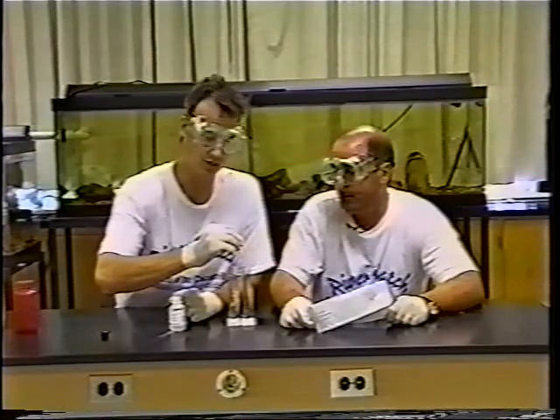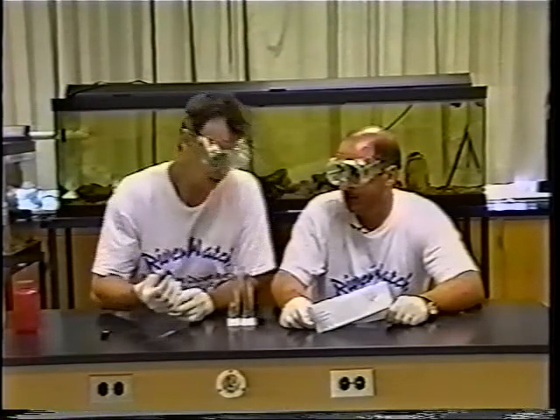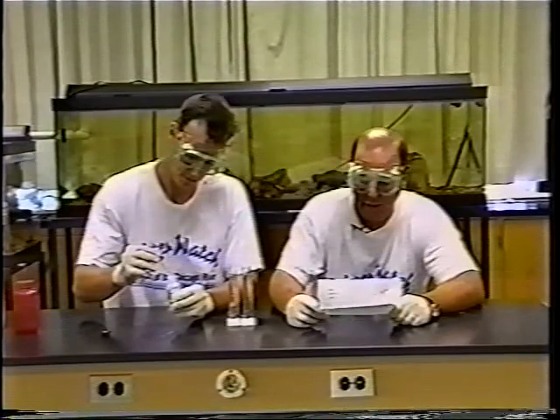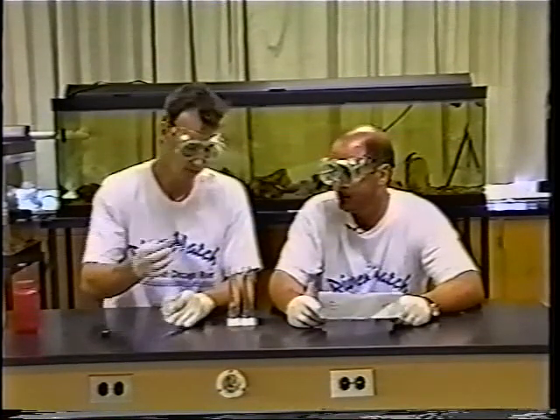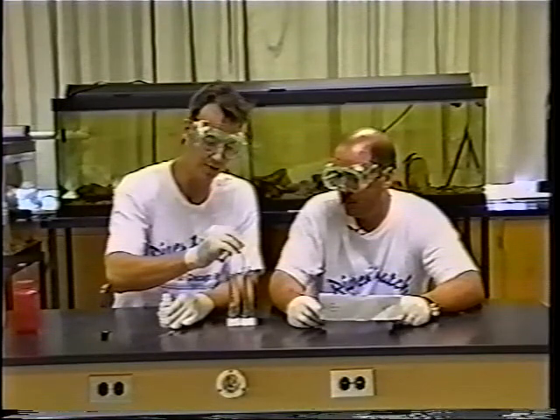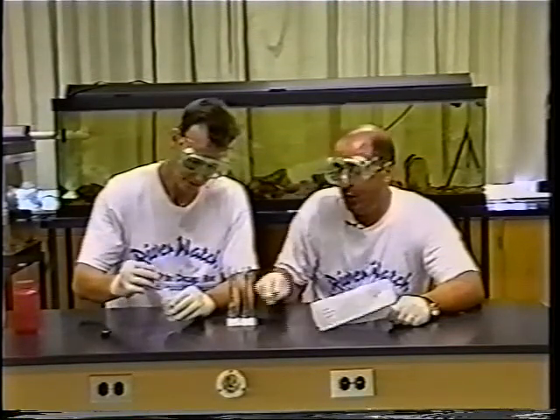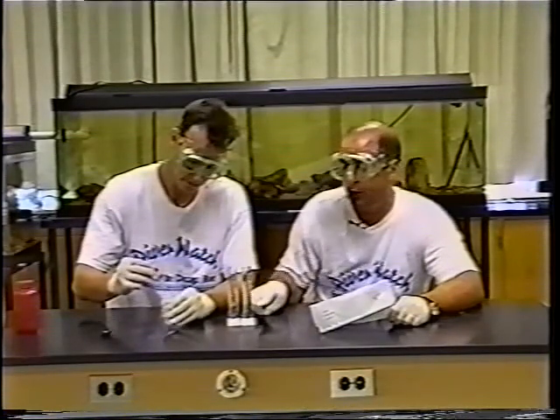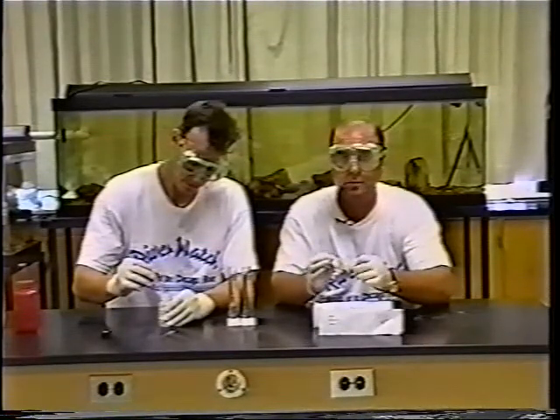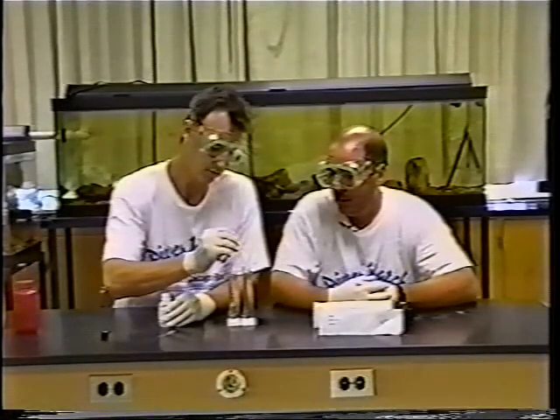Make sure you add the reagent to the deionized water sample, not the river sample. After every half-dropper full, check your dots again. If they're still not equal, keep adding drops of turbidity reagent in 0.5 milliliter increments until they're equally turbid. As you would with any chemical titration, make sure your dropper is clear of the side of the glass and you're going straight in with the chemical. This is our third dropper full and they're still not the same.